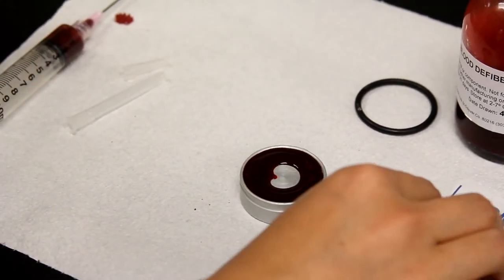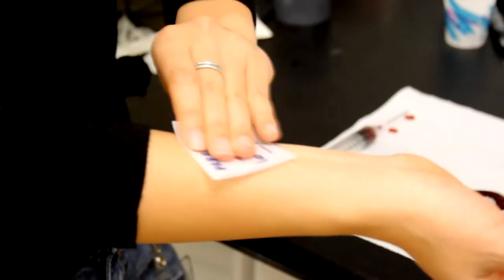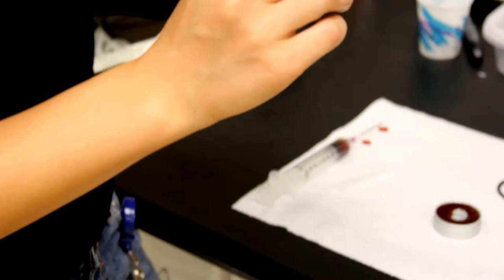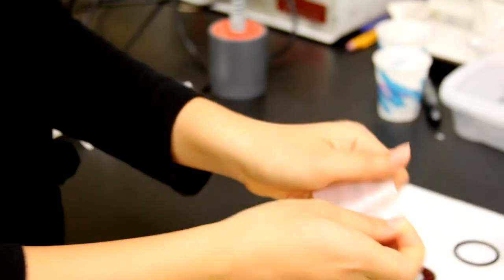Next, you'll need to cut out a piece of parafilm that is large enough to cover your reservoir, and rub this piece onto your skin to obtain human scent. Make sure that the user is not wearing any scented lotions or perfumes as it could interfere with the feeding process.